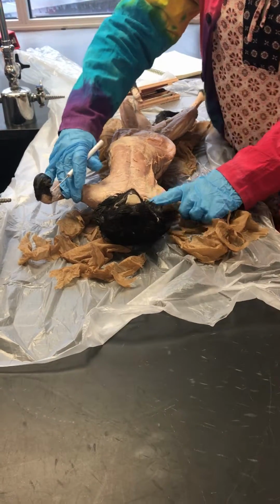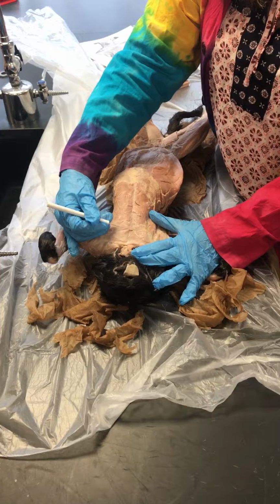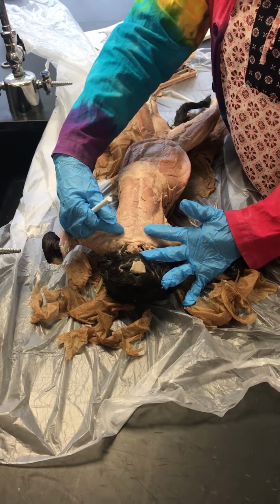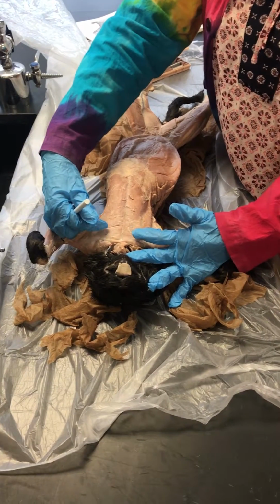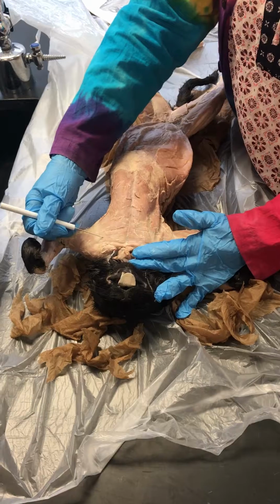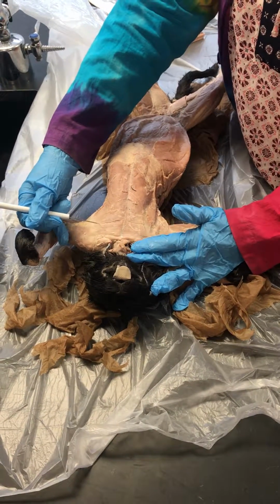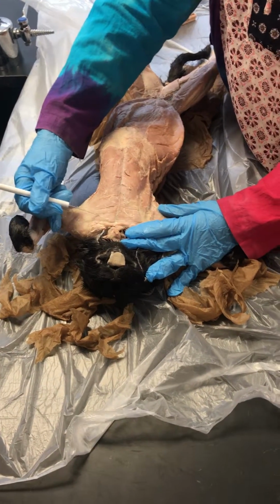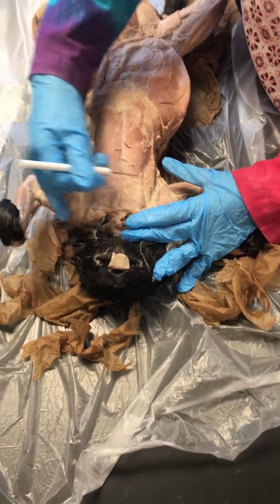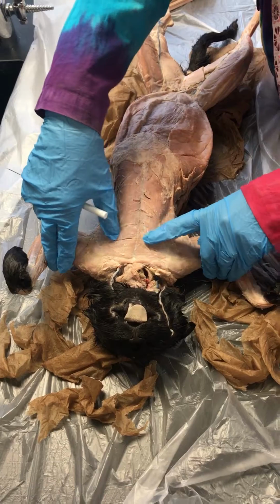Chest muscles. Right, so you have the chest muscles. They have it cut nice and neatly here. Pectoantebrachialis is the top chest muscle that you were responsible for looking for. The fibers go directly into the midline, so it is perpendicular to the midline. So pectoantebrachialis up here. The next muscle that kind of goes at a V is the pectoralis major.